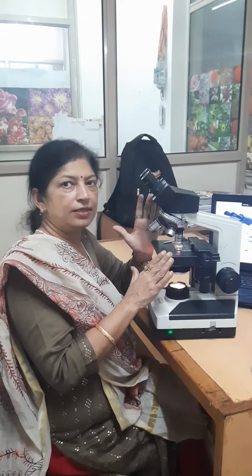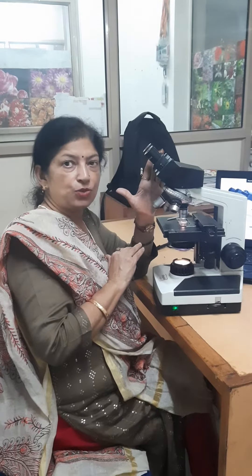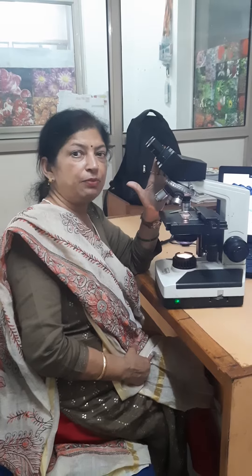Today we are going to understand the different parts of a microscope. The microscope I am showing is a compound microscope, also known as a light microscope.